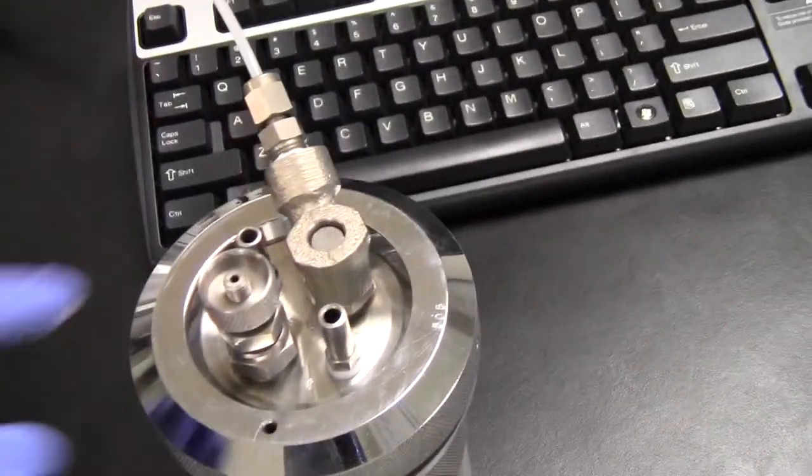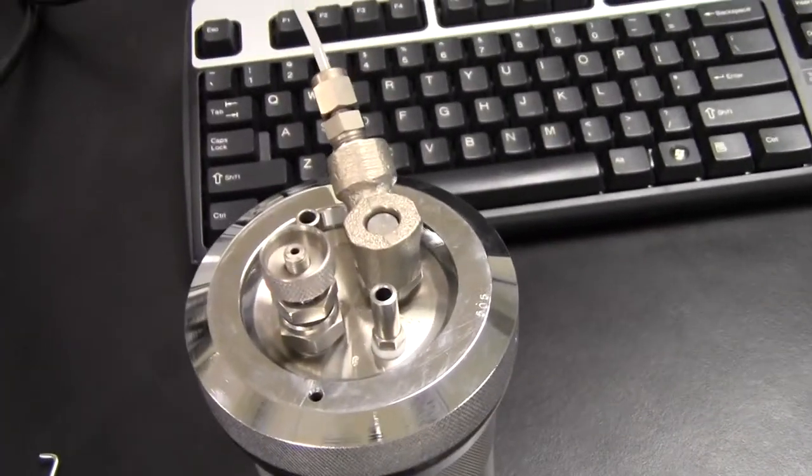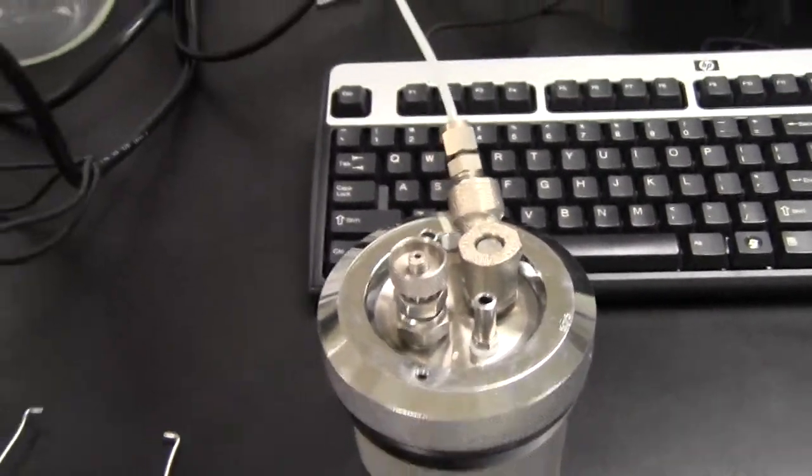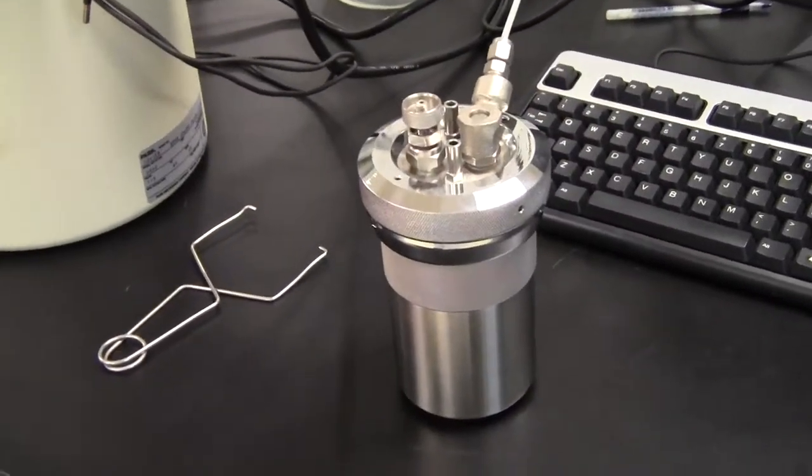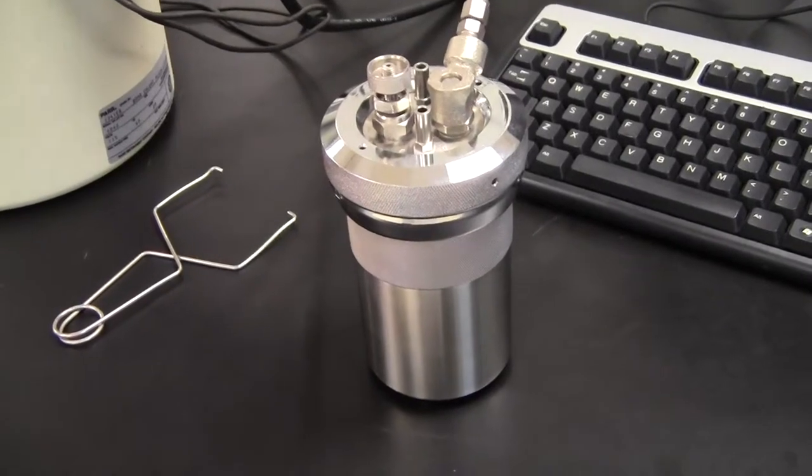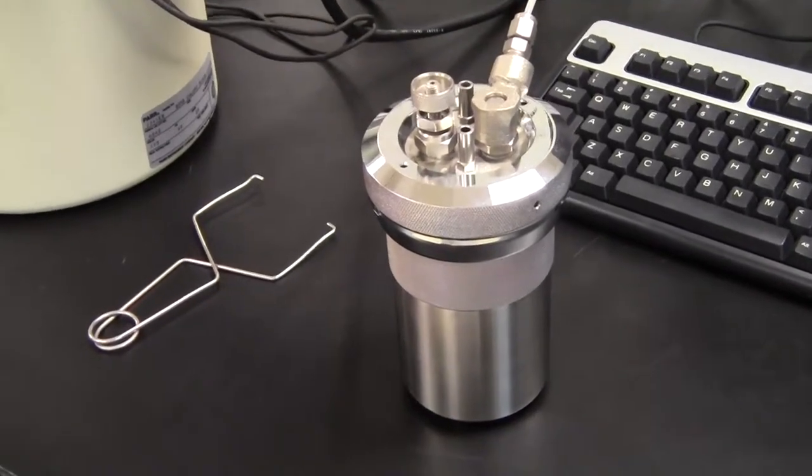It only goes on one way. There's nothing to thread. It just pops on like so. But it'll be the instructor that will fill this from the oxygen tank for you, and we'll charge it with 20 atmospheres of oxygen.